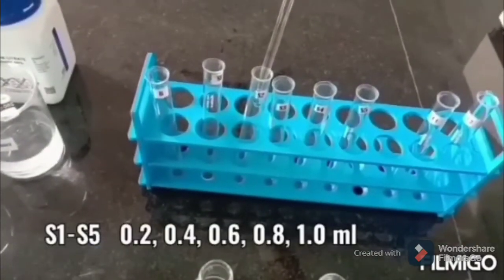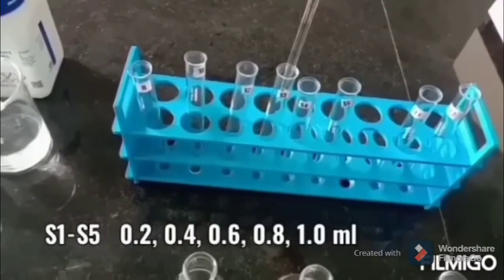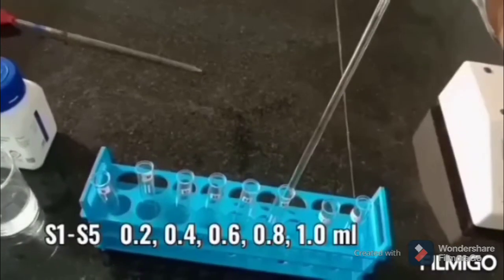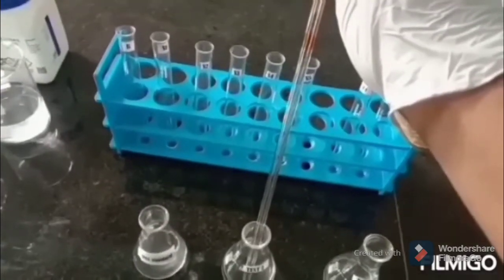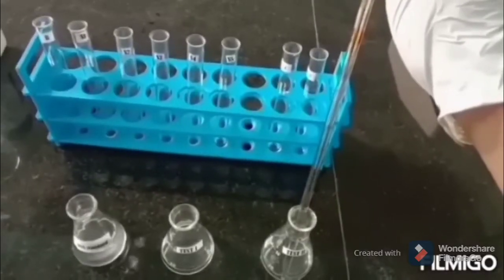Add exactly 0.2, 0.4, 0.6, 0.8, 1.0 ml to standard tubes marked S1, S2, S3, S4, and S5. Now accuracy of addition is very important here in a quantitative analysis for accuracy of results.